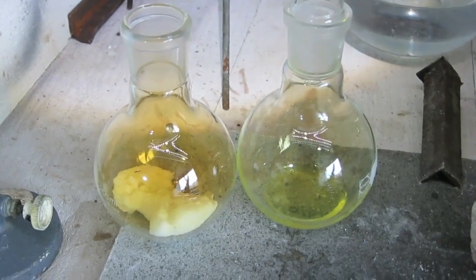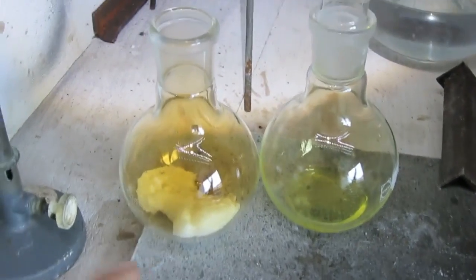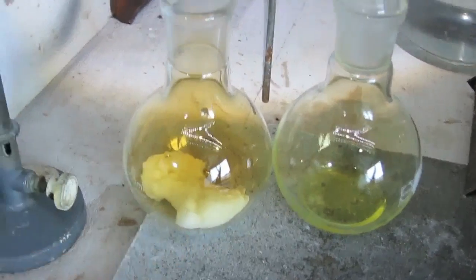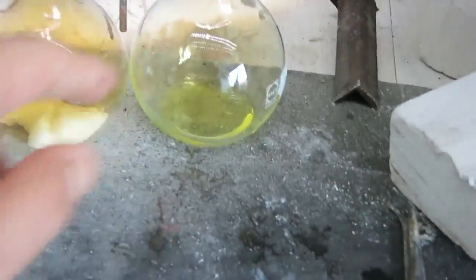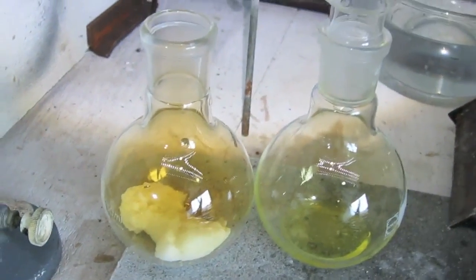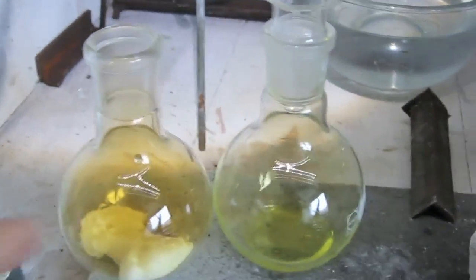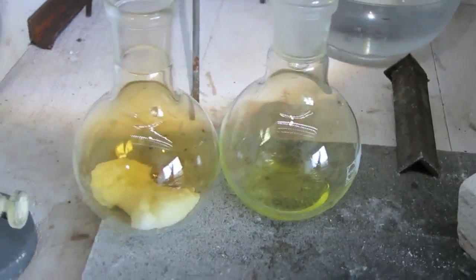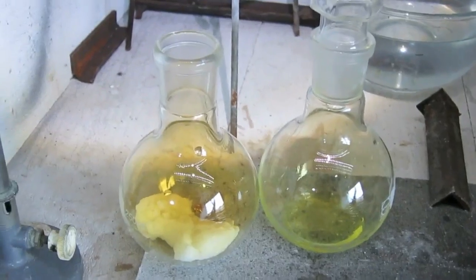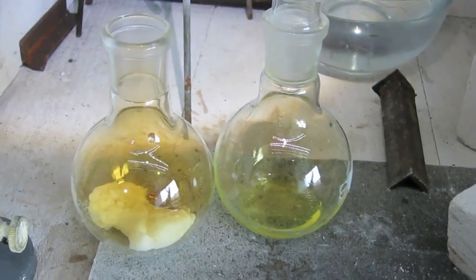So this is the final result. On the left this is KHSO4 the result. And this is the nitric acid. There's still some brownish brown NO2 above it. So if you blow it out and then I have to clean the flask and then it's finished. This is HNO3. Nitric acid.